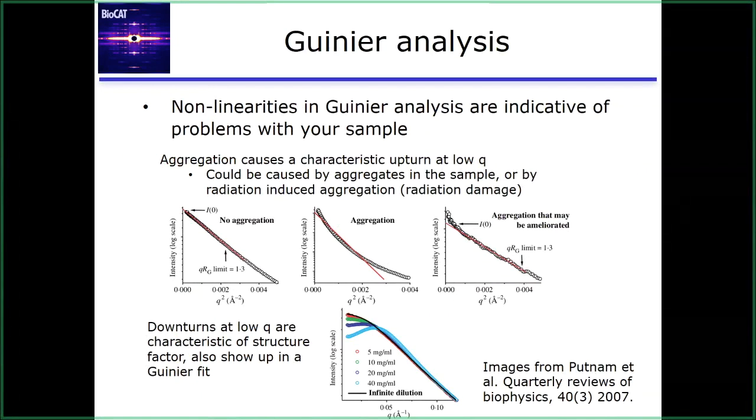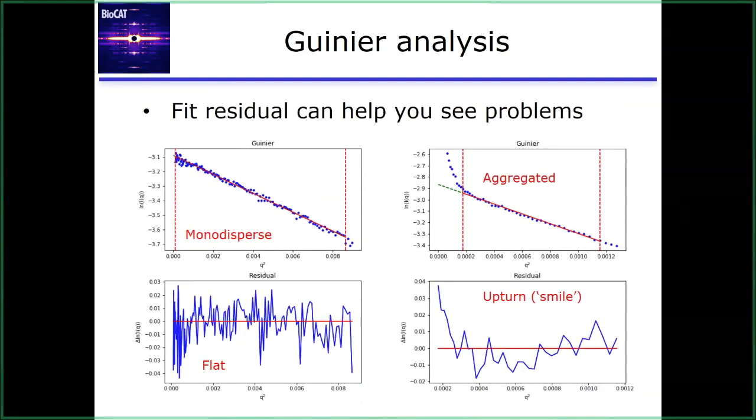So downturns at low Q. I'm not showing Guinier fits for this, but this is just to remind you that structure factor, usually from concentration, show up as downturns at low Q. Those will also show up in the Guinier fit. Even a little more concretely, you don't just have to look at the fit. You want to look at the fit residuals. So if you have something that's nice and monodisperse, the fit residual should be flat and randomly distributed about 0. If you have something that shows aggregation, you can see even though I've cut off some of the fit here, we're still getting this characteristic upturn in the residuals.